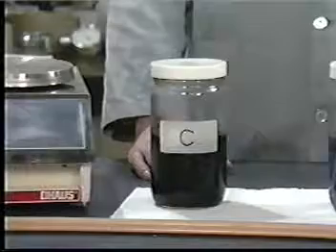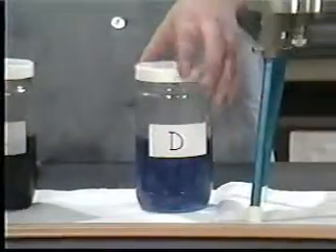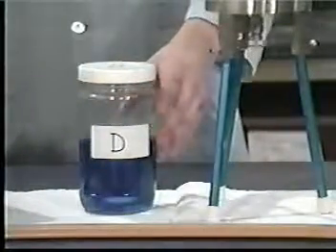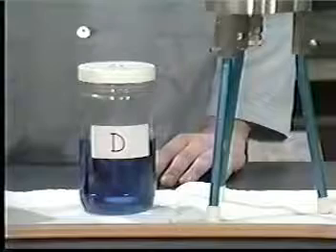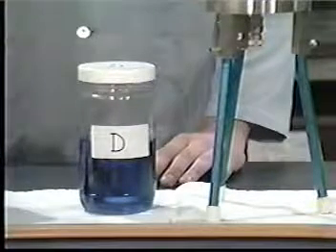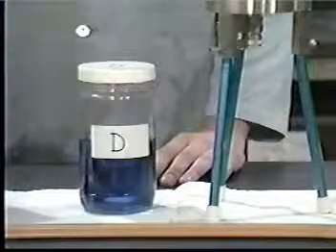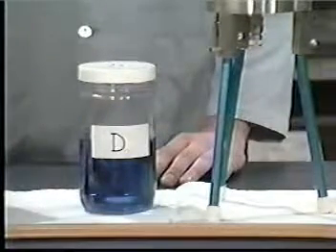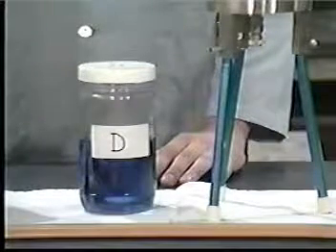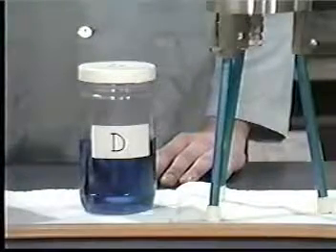The last case is a waste which is less than 0.5% dry solids, such as our example D. Since the amount of solid material in such wastes is too insignificant to require extraction, the initial filtrate will equal the TCLP extract. Be sure to filter enough liquid to support all the analyses required. Using the guidelines just explained, weigh out an appropriately sized representative subsample of the waste and record the weight.